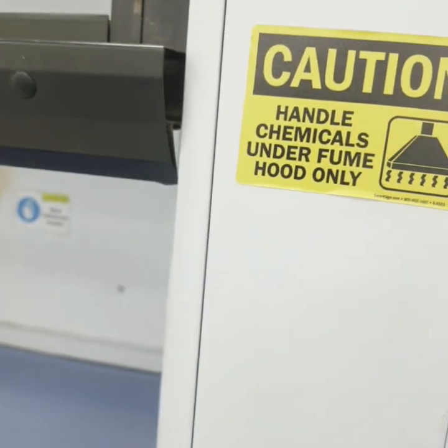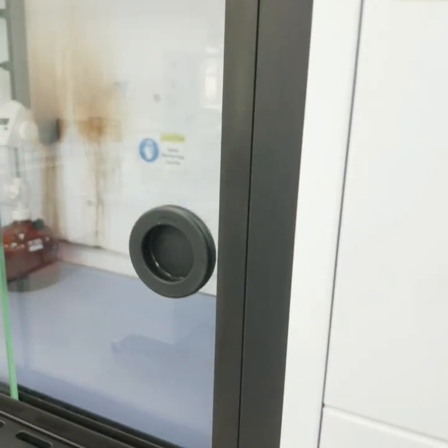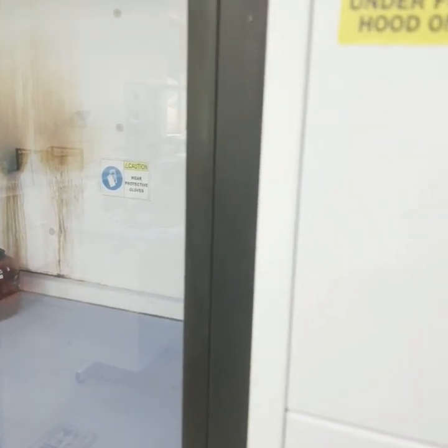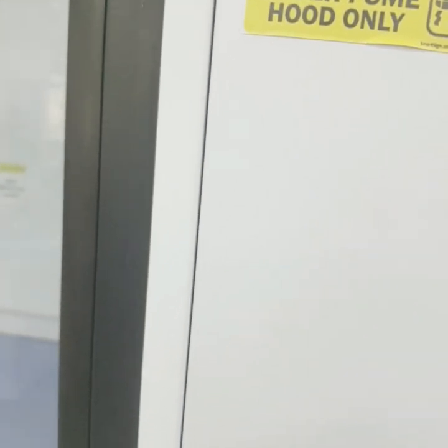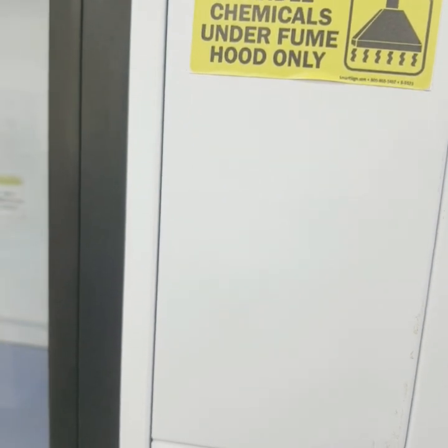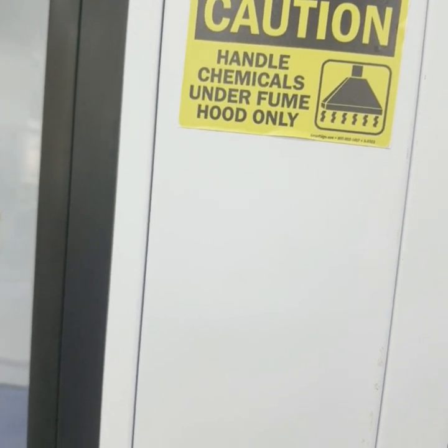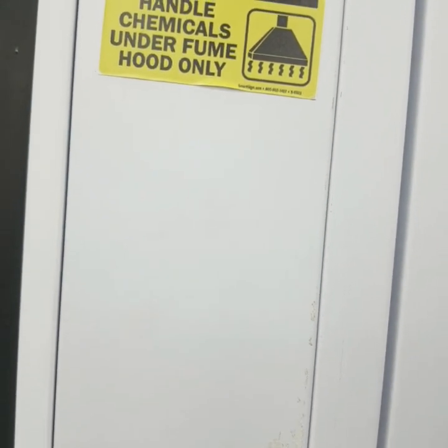If the fume hood sash is set too high, the fume hood alarm activates. Check the sash height to ensure it is at the proper height as indicated on the label. If the alarm is still sounding, discontinue use, close the sash, post an 'out of order' sign, and arrange for repair by the providing company. The sash should be kept in the lowest possible position — no higher than 18 inches.